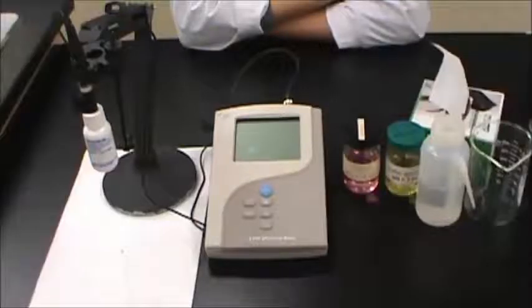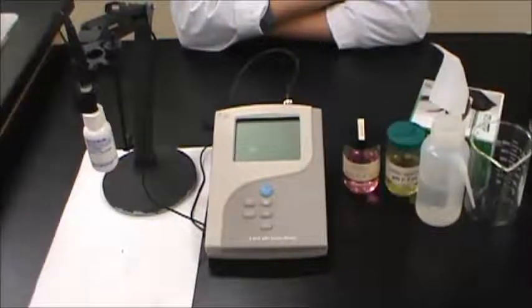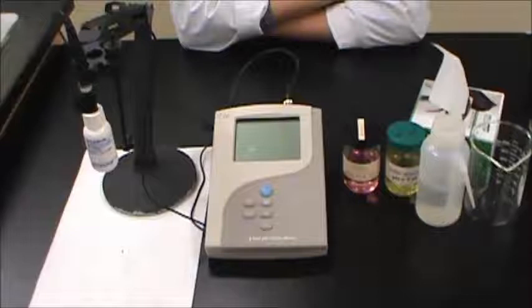This is the instructional video for a two-point calibration of a Beckman 340 pH meter. Before you begin, make sure you have the following items.